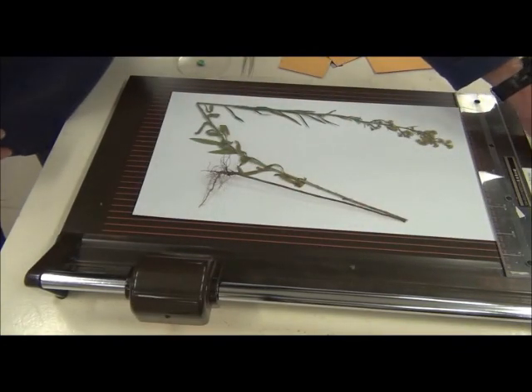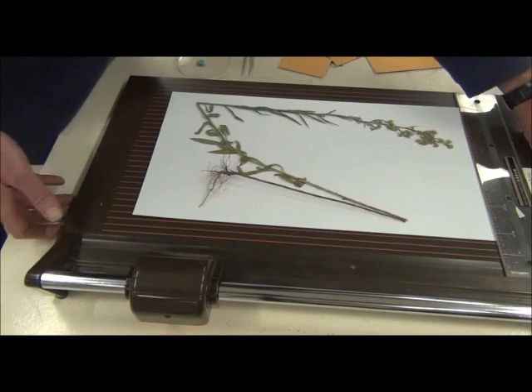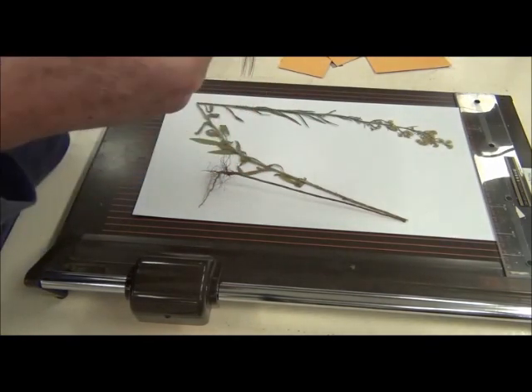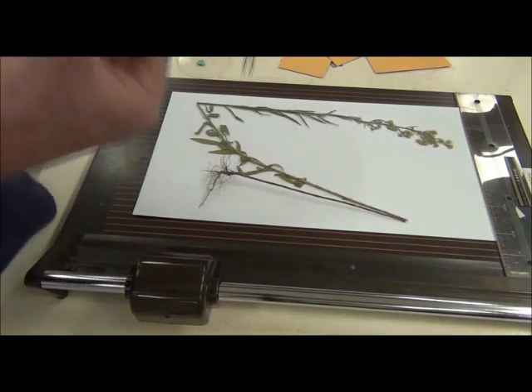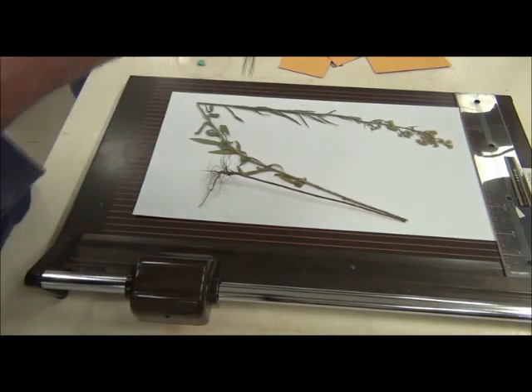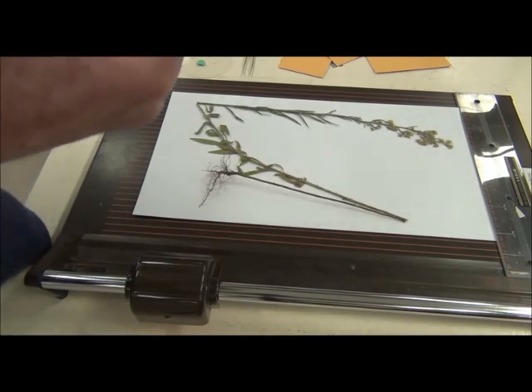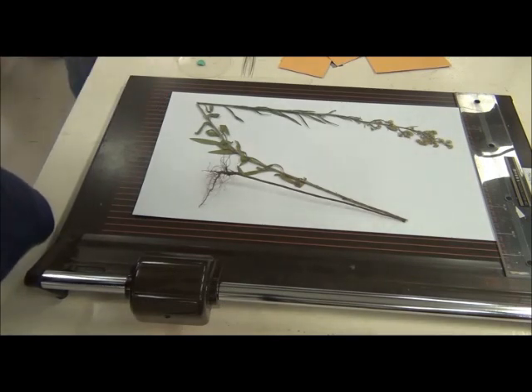With this paper, it's the glued paper. There are herbaria around the world that still use archival quality, either cloth or paper that's glued to put down specimens.